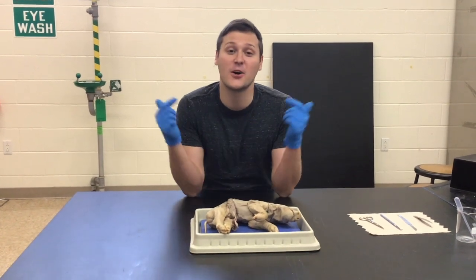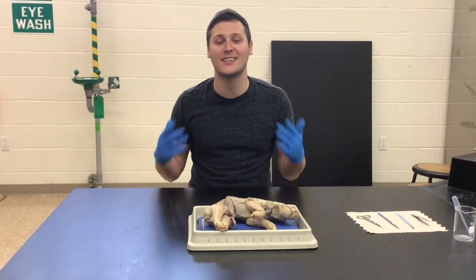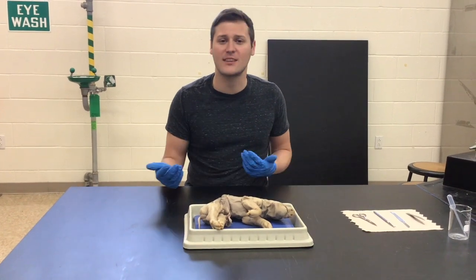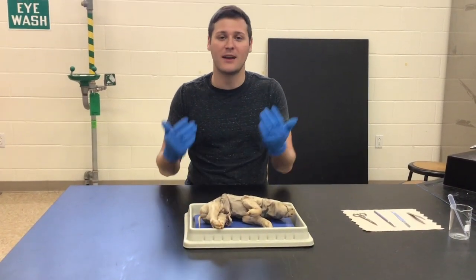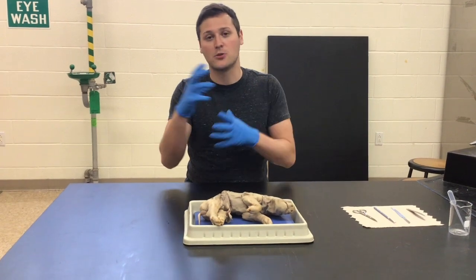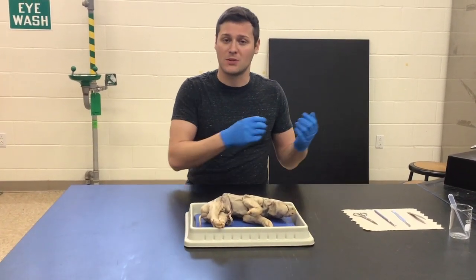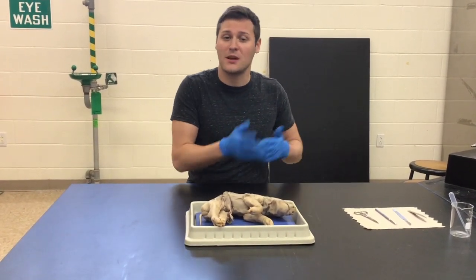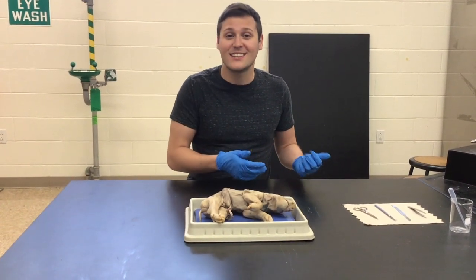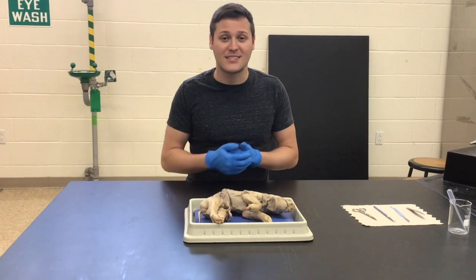How's it going, you guys? So in this video, we are going to dissect a fetal pig. There are a lot of other things that get dissected in this classroom, but I decided on the fetal pig because, evolutionarily speaking, they are very closely related to us compared to some of the other things we would have otherwise dissected, like a rat or a frog, for instance.